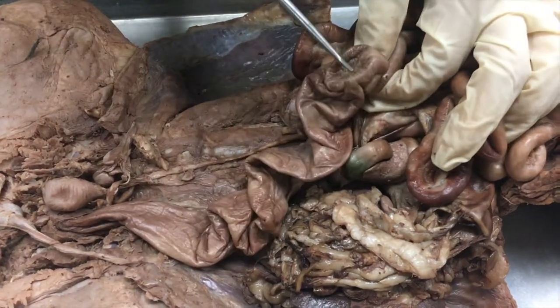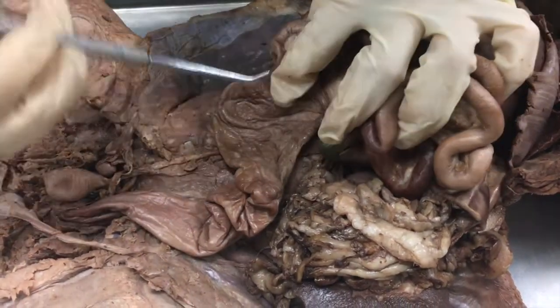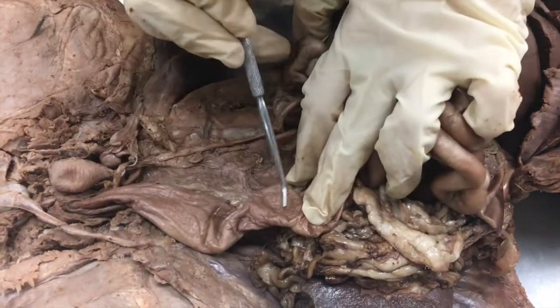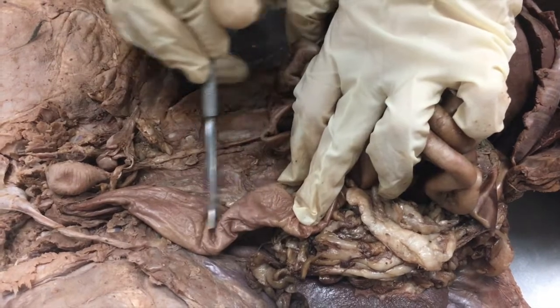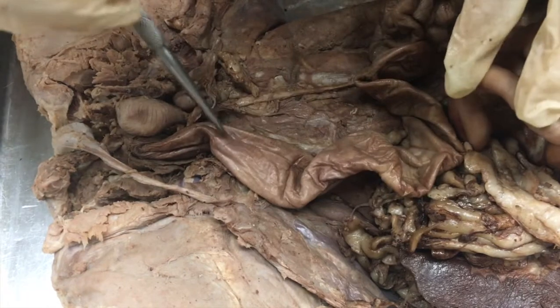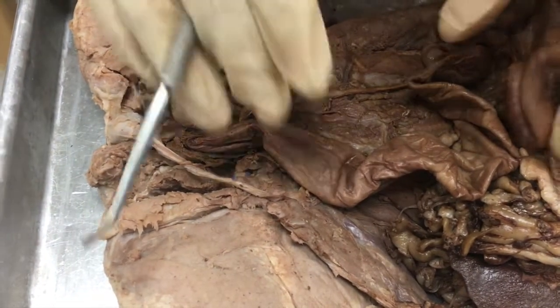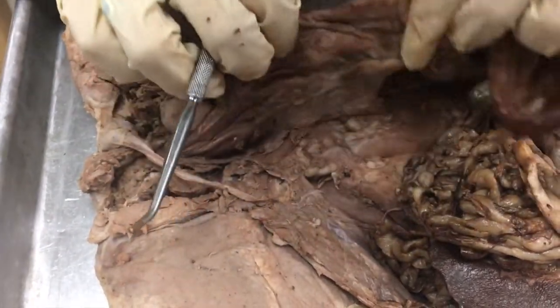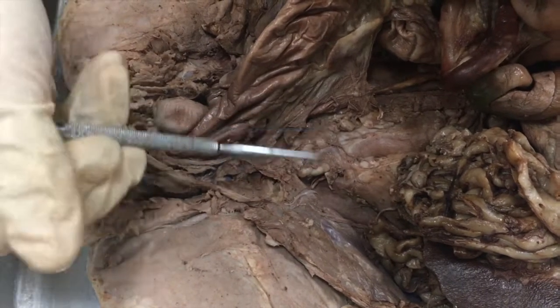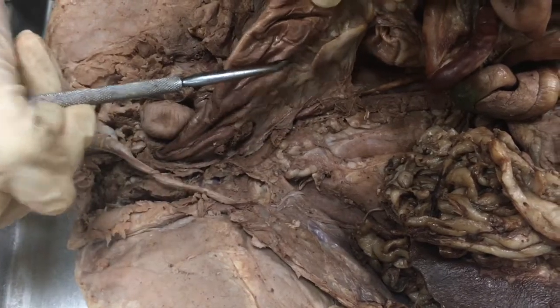Next you have the ascending colon here, the transverse colon which comes across, the descending colon which is a little bit closer to the top, the sigmoid colon which usually lays like this and forms an S shape, and then the rectum which is all the way down at the bottom. You also have the mesocolon, which is the tissue that connects the abdominal wall to the large intestine.